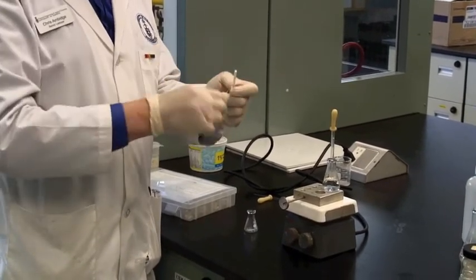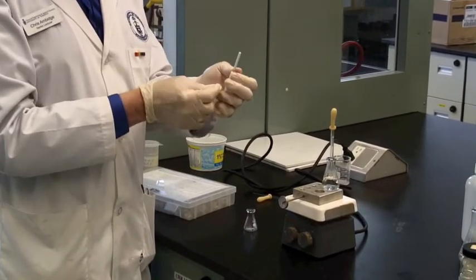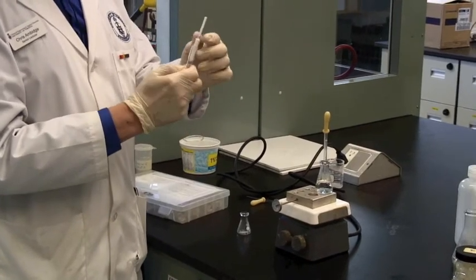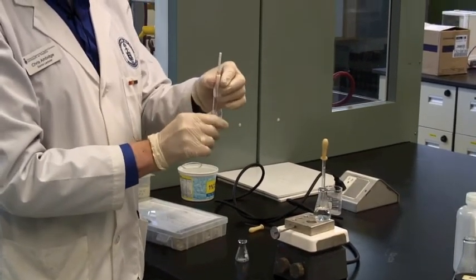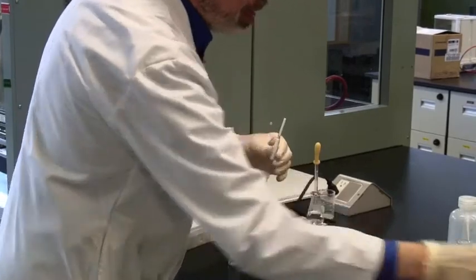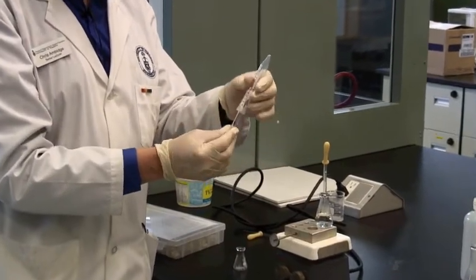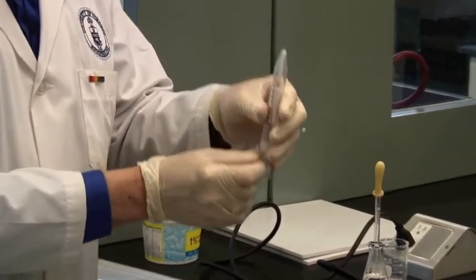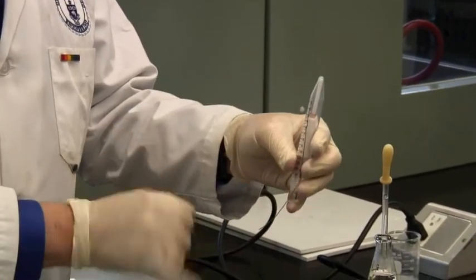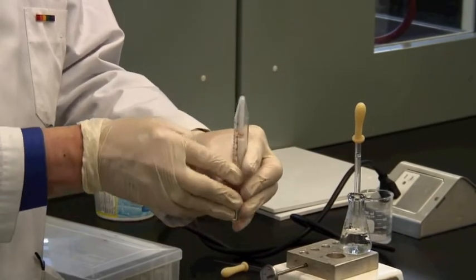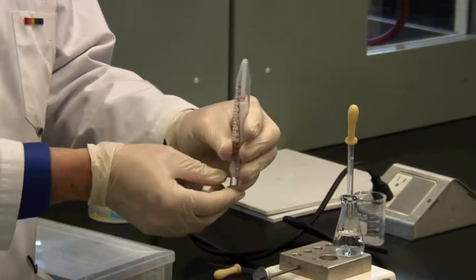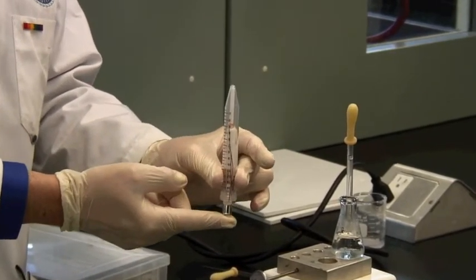Then take your centrifuge tube, and the whole item goes in the centrifuge tube, with the handle of the pestle all the way to the tip. Then bend the wire over like that, like a hook, and we now go to the centrifuge.